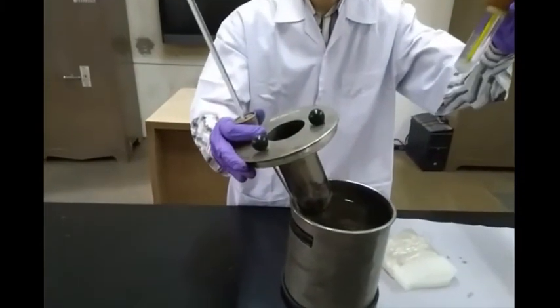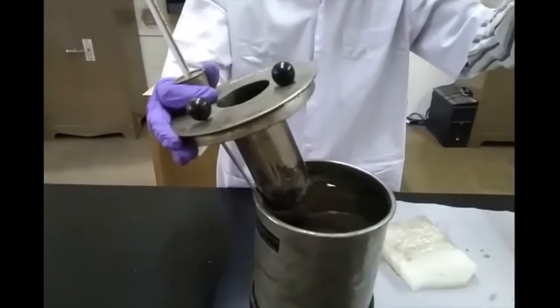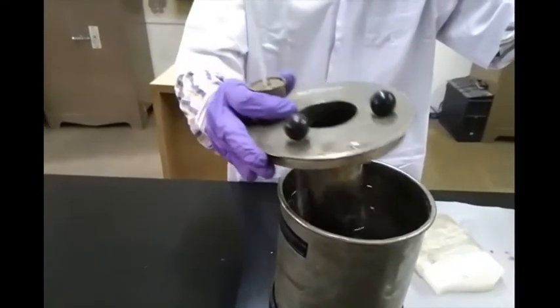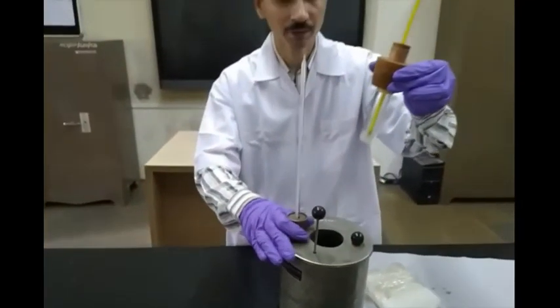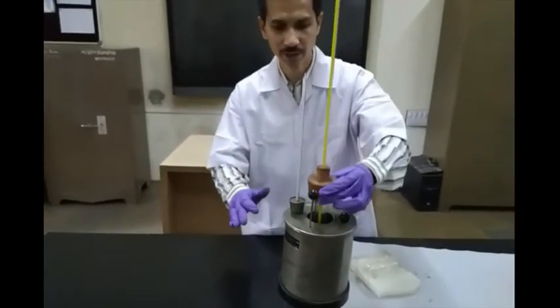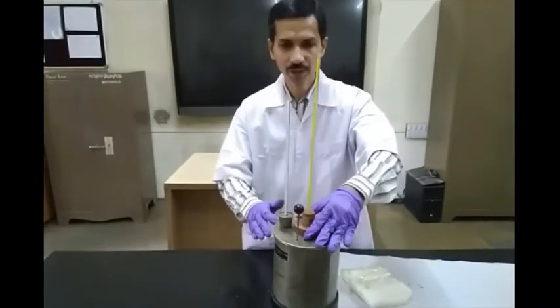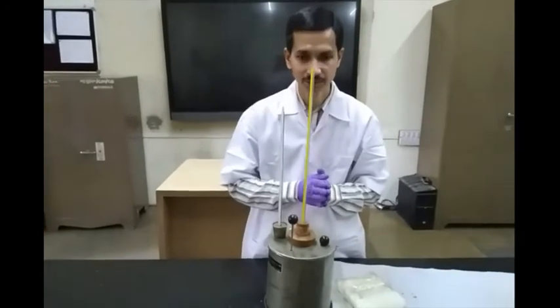This water bath is placed with a stirrer — you can check the water bath, we have water in it and also a stirrer inside it. Now this is an air gap, and we will be placing the test tube in the air gap. Once we place it in the air gap, we start taking the readings.